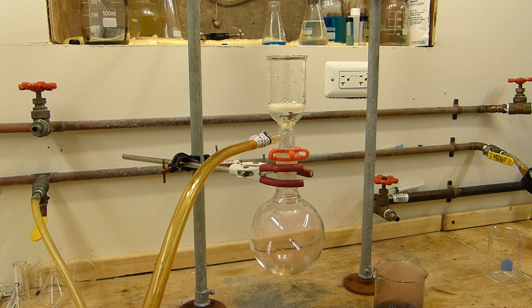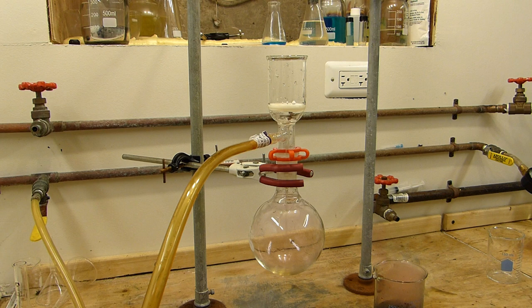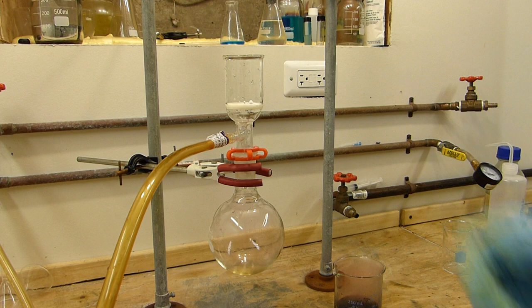Okay I'm now set up for vacuum filtration and we'll go ahead and filter and wash the iodine. First let me turn on the aspirator. Start suction.